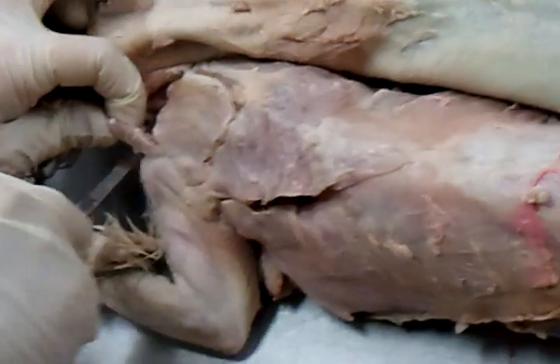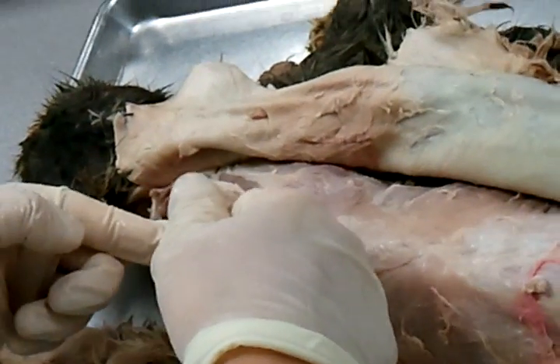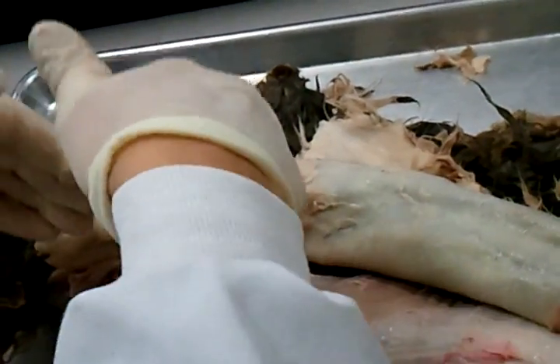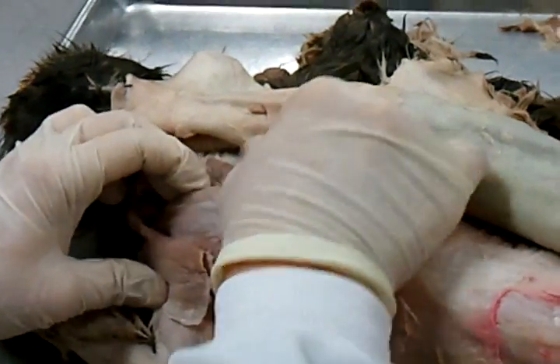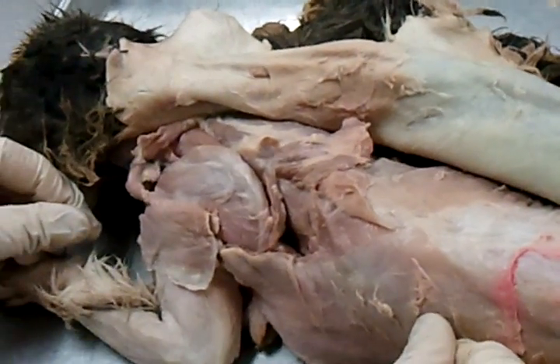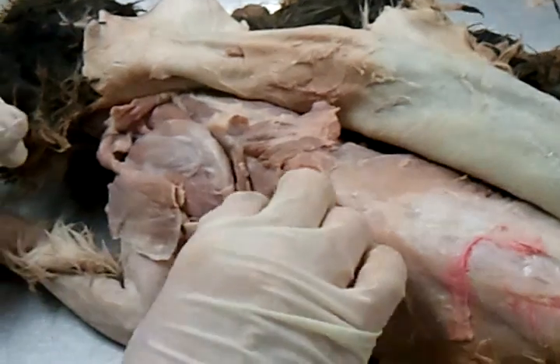Now here's what happens. There's a whole bunch of muscles on the scapula and between the scapula, deep under this trapezius muscle — it's on the surface. So if I take the trapezius back, you've got a whole new world under there. And you've got to know it.